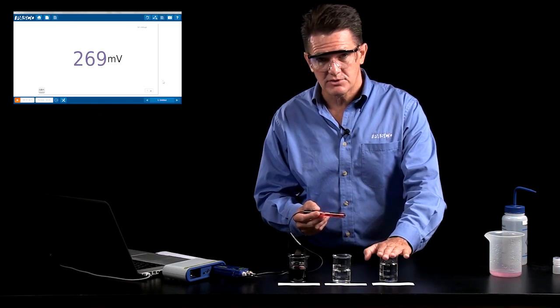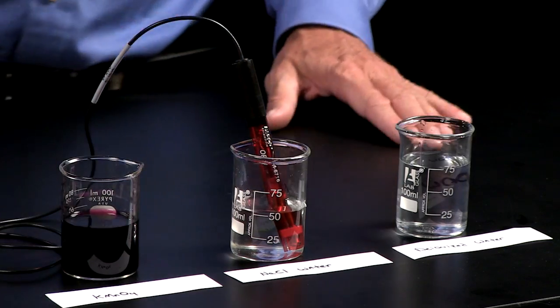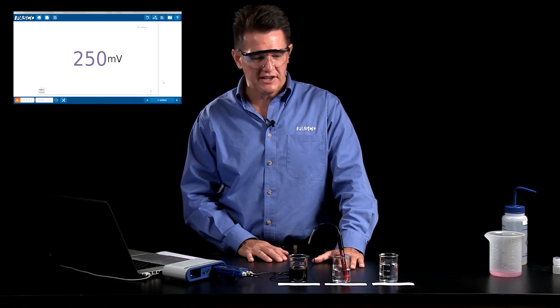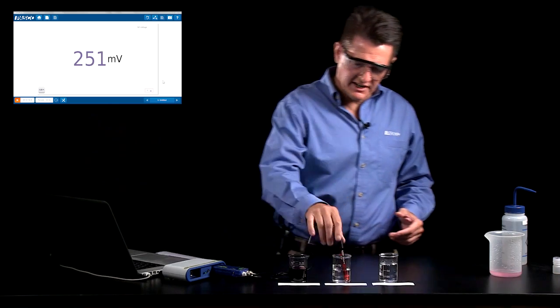Since this was deionized water, I'm not going to bother rinsing it. I'm going to put it straight into my sodium chloride solution, my salt solution. And you can see it's reading about the same, so it's also not very oxidizing or reducing.